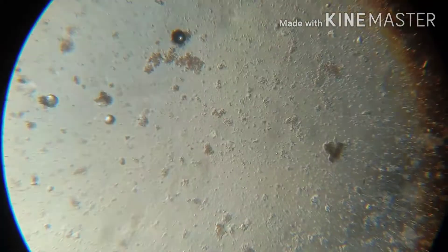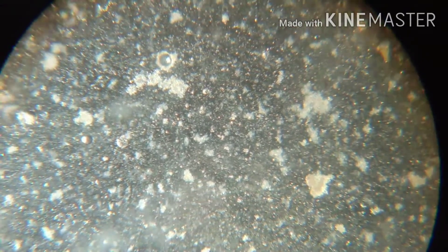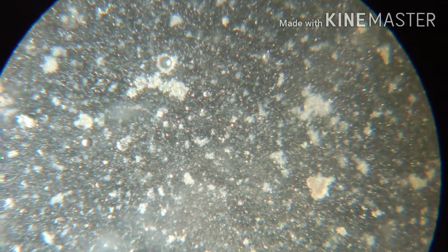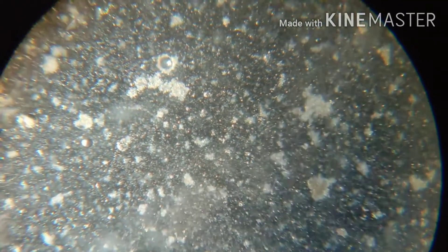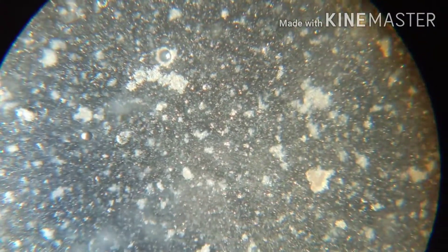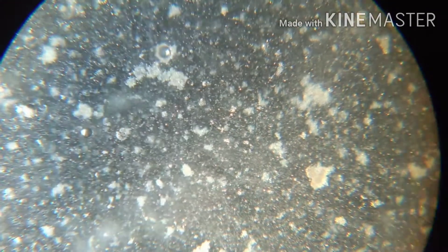As I turn on the dark field mode, you may be able to view those flashing, twinkling microbes inside it. They are less in content. The protein too is kind of less — you can see the white lumps, which are pretty visible there.